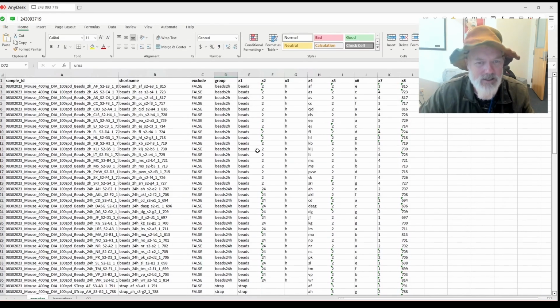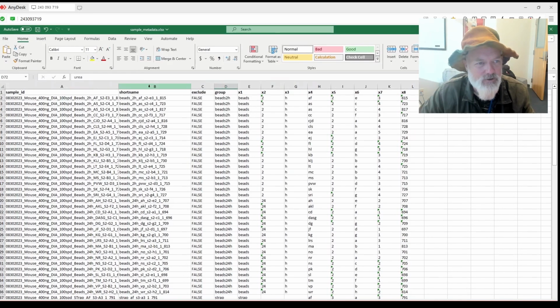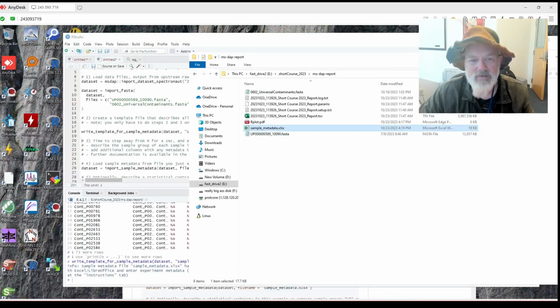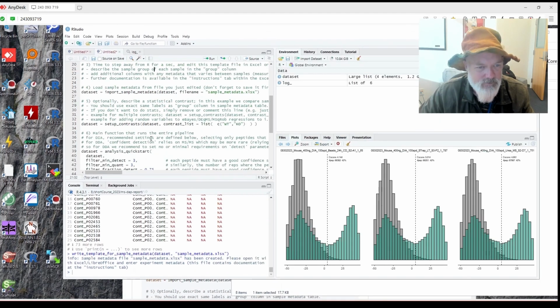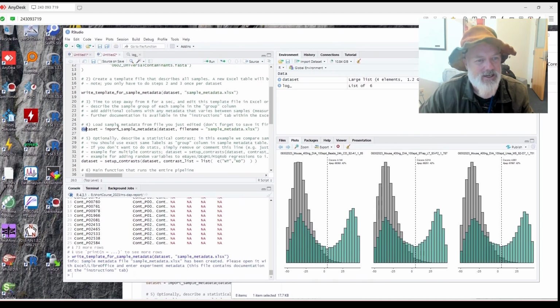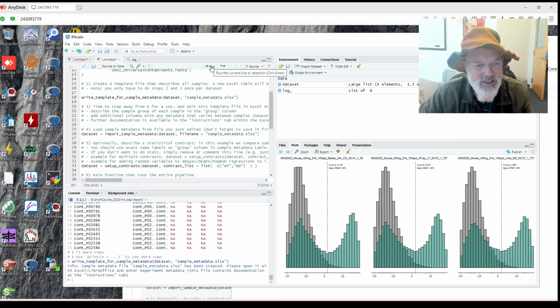Okay. And then basically once we had the group, which is the condition, we hit save. We save it again. And then basically what we do is we then re-import it. It makes it super easy. It was so simple, I didn't understand it. But once I got it, it's dead simple. This is very, very elegantly designed.